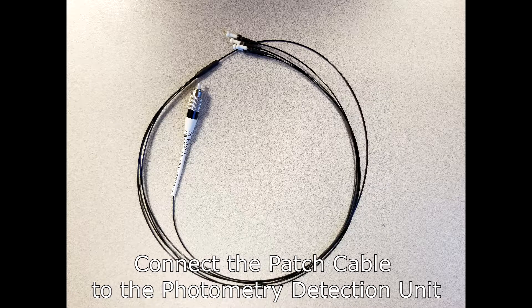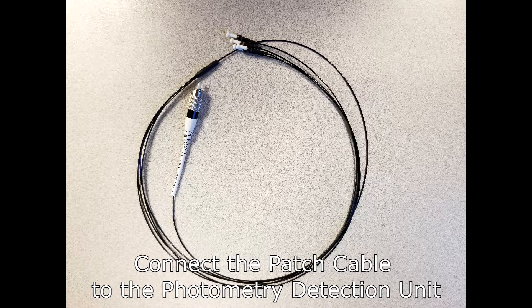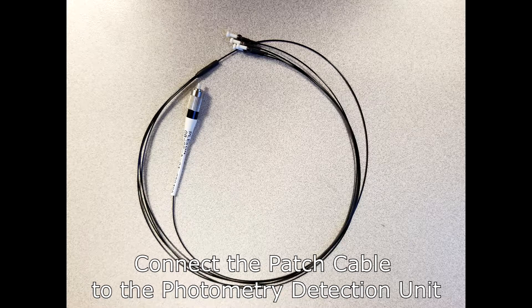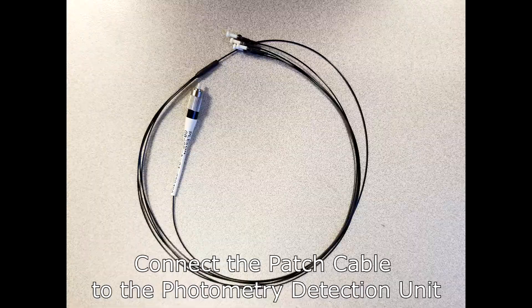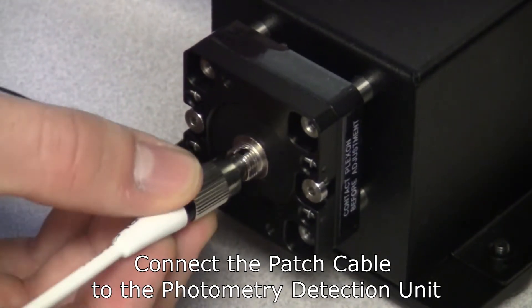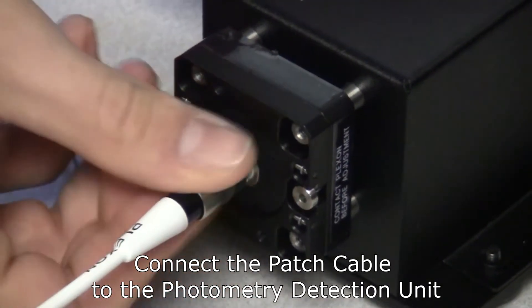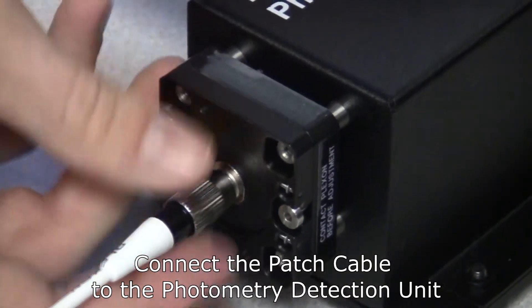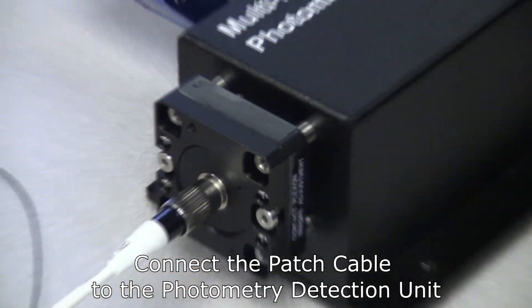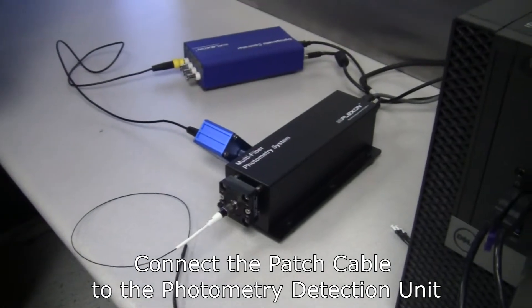We will now be connecting the patch cable to the optical port of the photometry detection unit. Note that there is a key on the male FC connector on the patch cable that must be aligned with a slot on the female FC connector on the photometry detection unit. Make sure the key is aligned in the slot and then push the collar forward and screw it down to secure the connection.